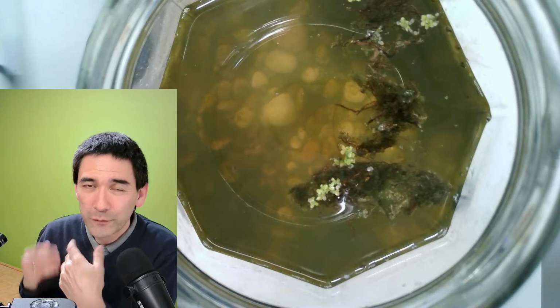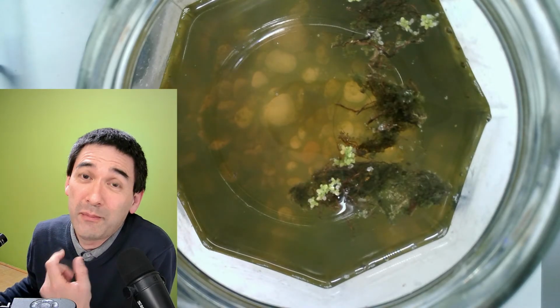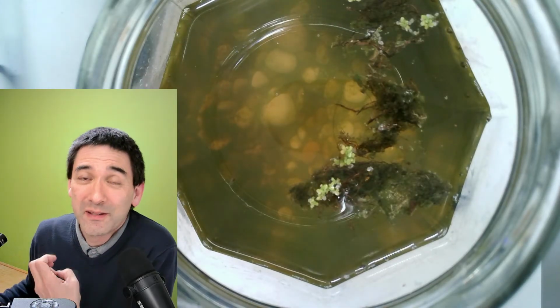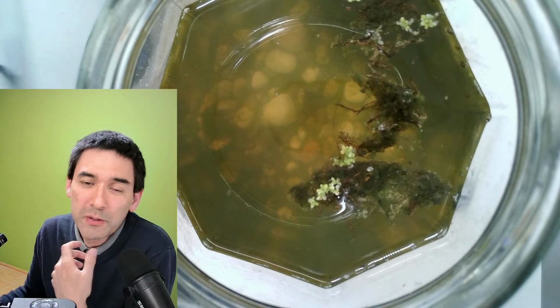So, from an educational perspective, I don't know. In schools, maybe. I think students still should work with a microscope and not just do everything on a computer, right? But still, maybe there are certain applications where this is actually useful. This would be something that would be quite nice.